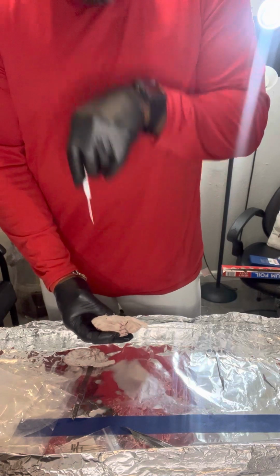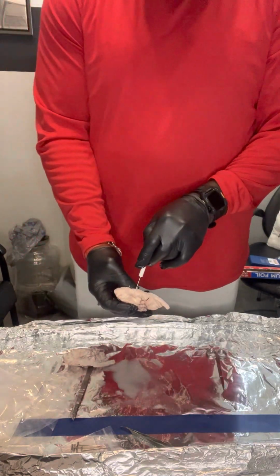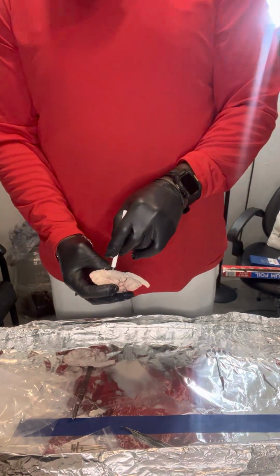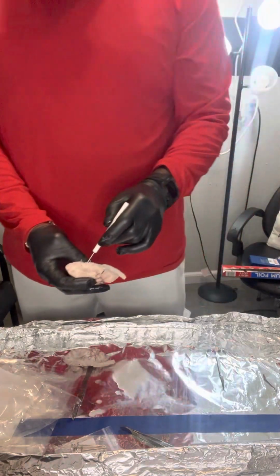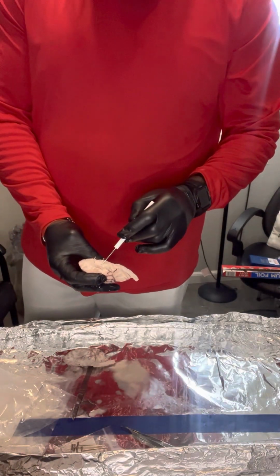And the thalamus, what it does, it's like a relay station. So it's communicating, it's networking. Sensories pick up, it communicates. To the best of my knowledge, I believe that's what that is.